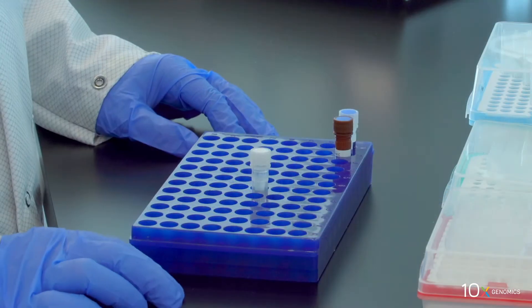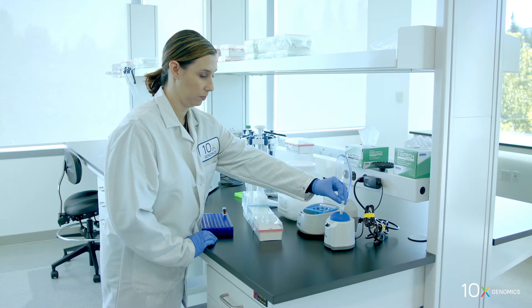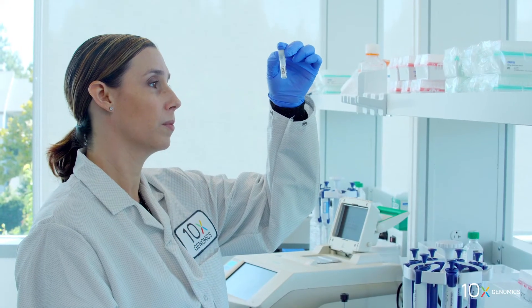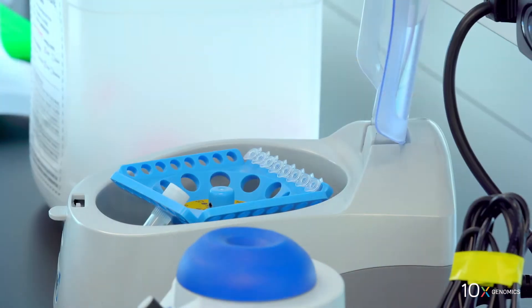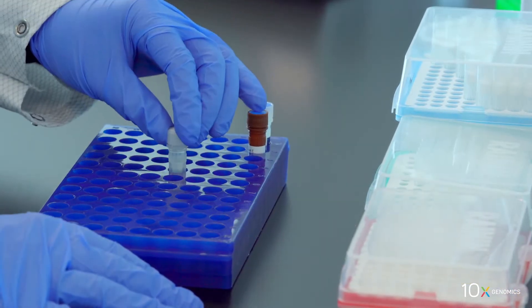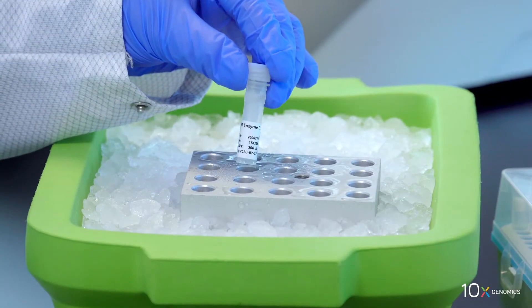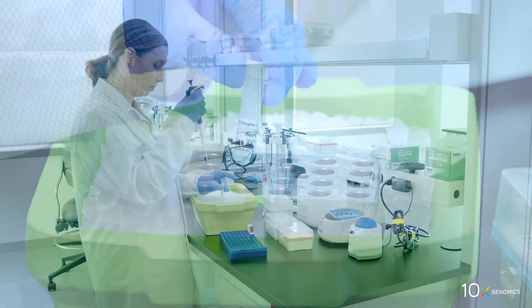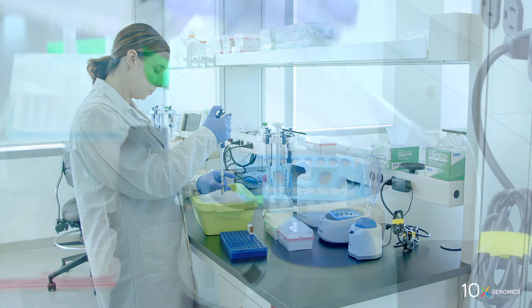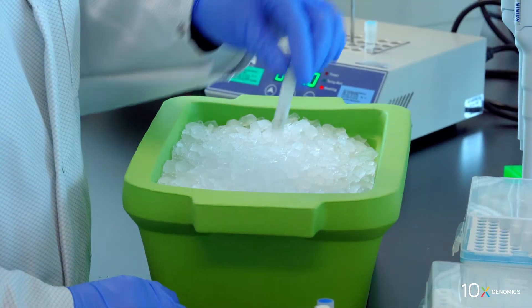We have reducing agent B. Thaw, vortex, verify there is no precipitate. Spin down briefly, and equilibrate to room temperature. We have RT Enzyme D. Pipette mix, spin down briefly, and place on ice.